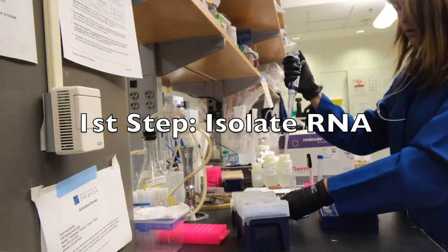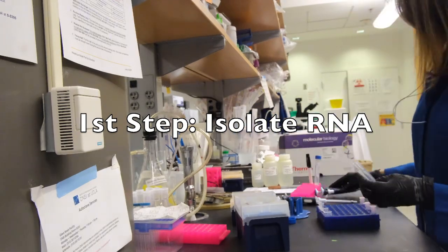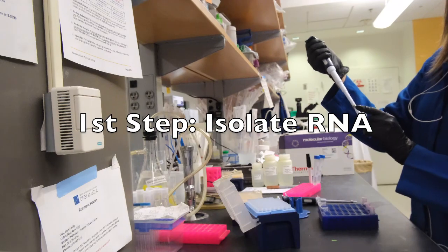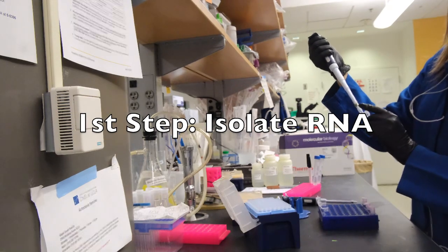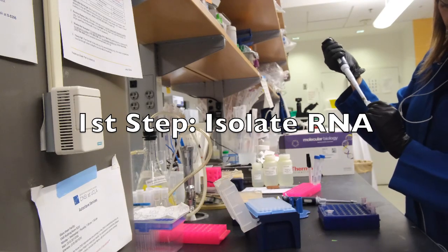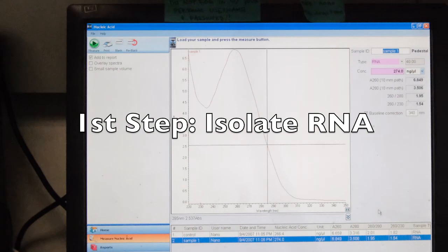Our first step would be to isolate RNA. Now, the isolating kit comes with multiple steps, such as the use of a lysis buffer and many washing steps. After isolating, we are going to read it in a NanoDrop machine to obtain concentration and verify purity.